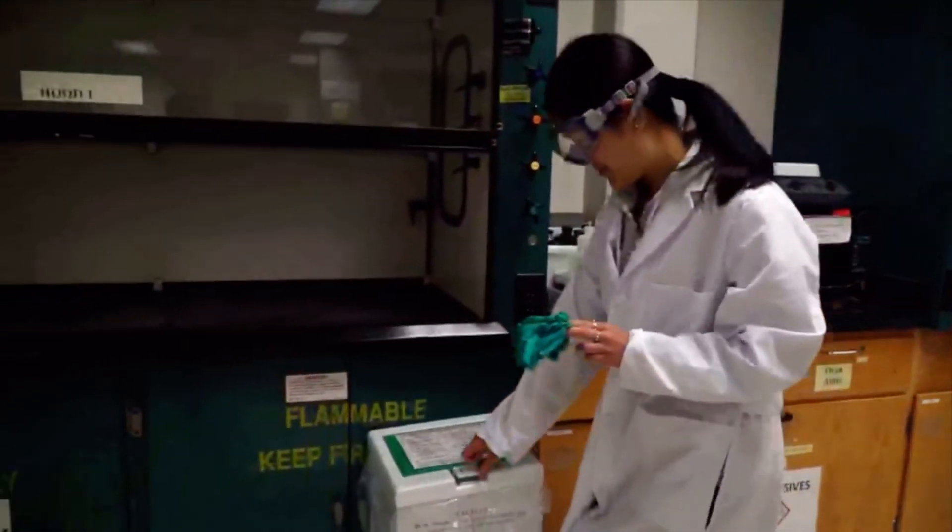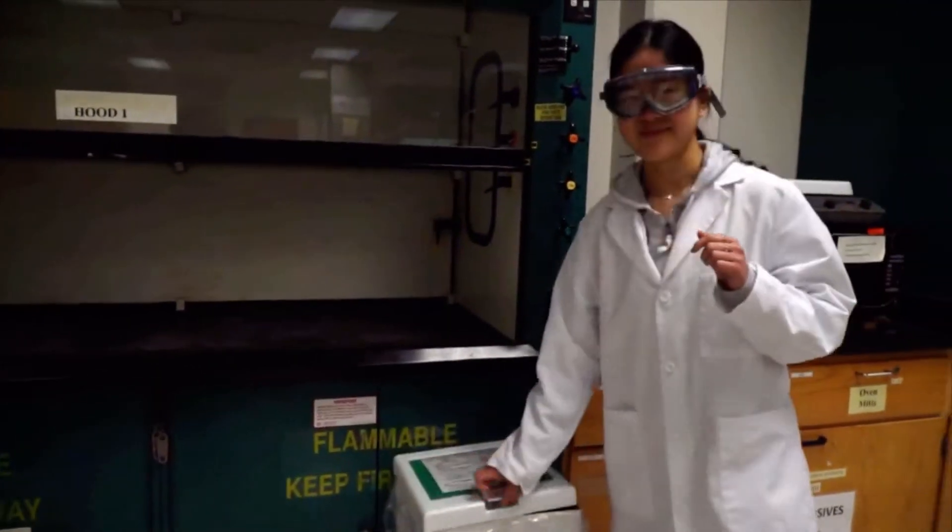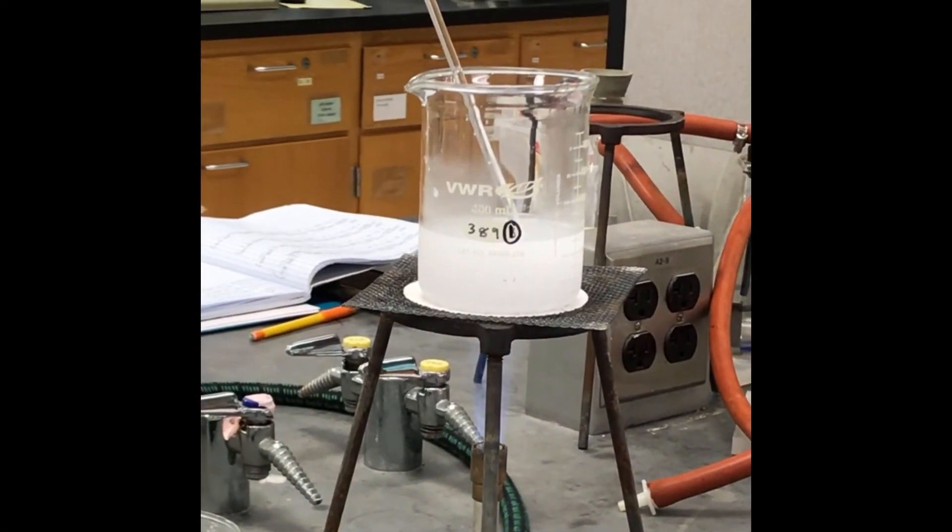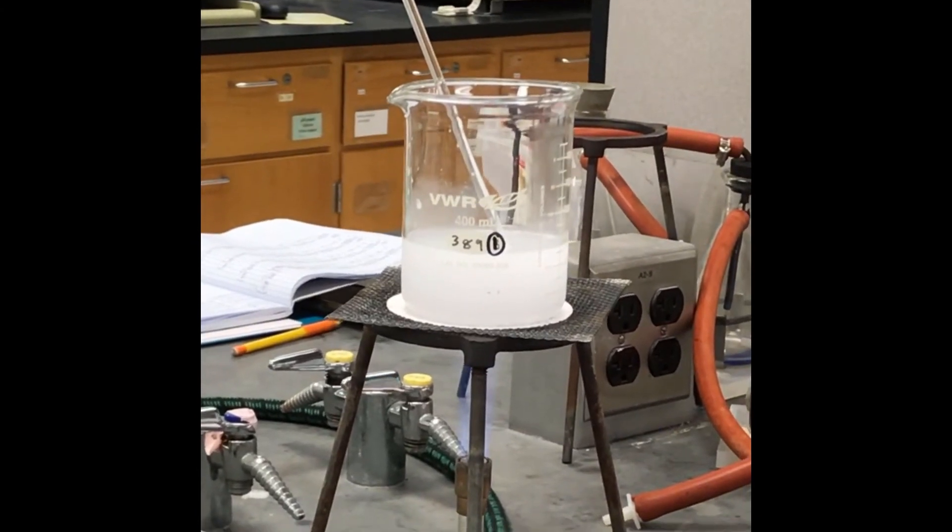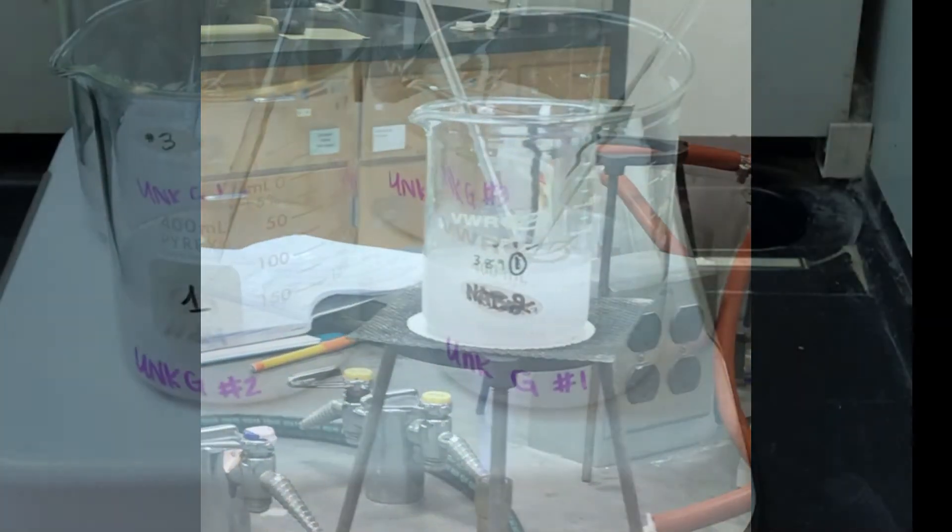Never throw gloves in the regular trash. You are now ready to digest the samples. Heat on a Bunsen burner until near boiling.